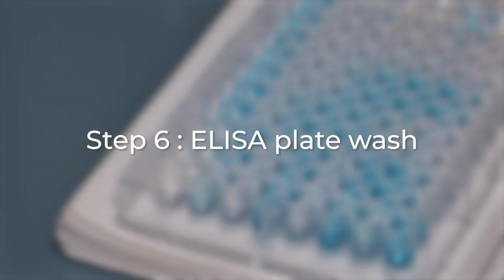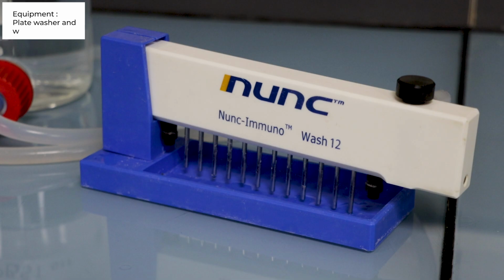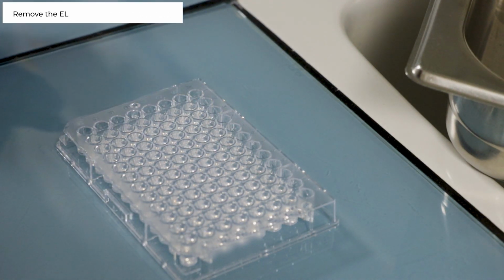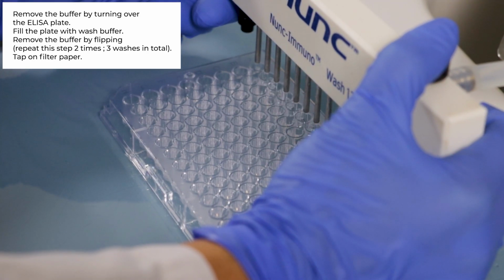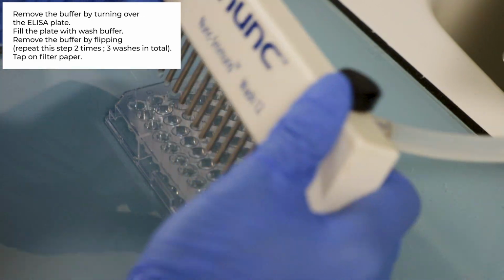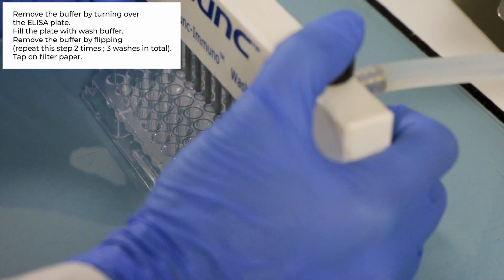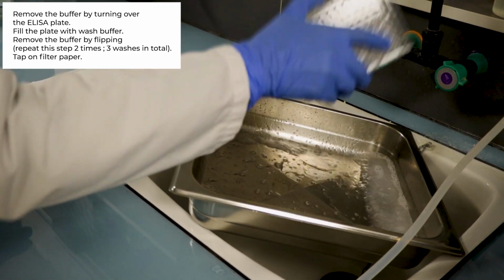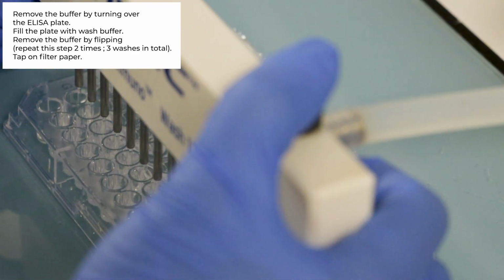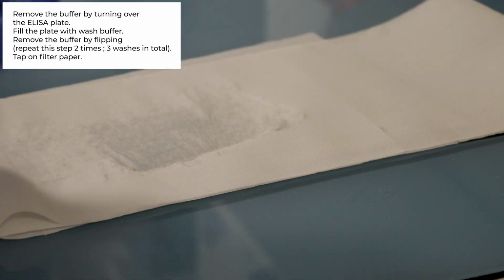Step number 6. Washing of ELISA plate. Using plate washer and washing buffer. Remove the ELISA plate from the incubator. Remove the sticky transparent film. Discard the buffer by turning over the ELISA plate. Fill the plate with washing buffer. Remove the buffer by flipping. Repeat this step 2 times, 3 washes in total. After the last wash, bang on absorbing paper.